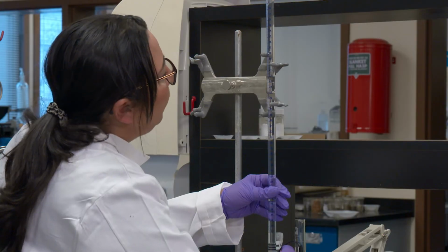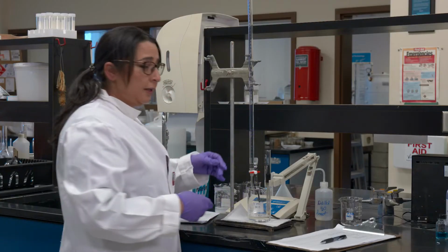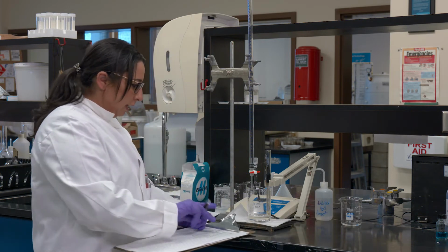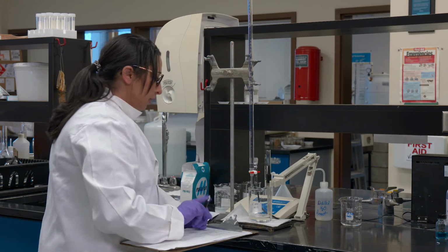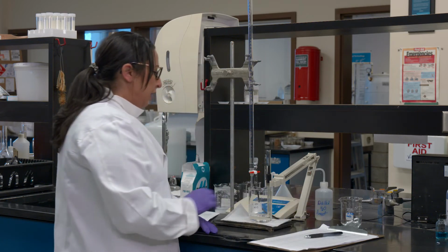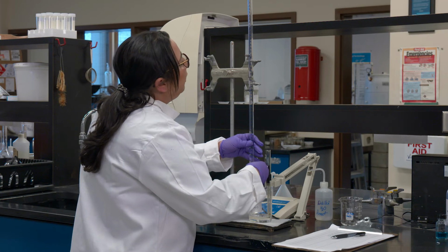So the way I'm going to interpret this is, we started with the carbonate, and now remember I told you these species are interchangeable. So now the carbonate has formed into bicarbonate. That's the visual kind of confirmation to that. So I'm still doing the same thing, stirring, stirring, stirring, and let it stabilize. And by then I will start taking my readings from the burette. And I'll wait for the pH to display. Okay, excellent. So we are at pH 8.79, another mil.